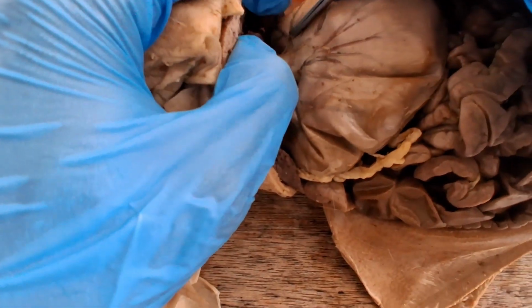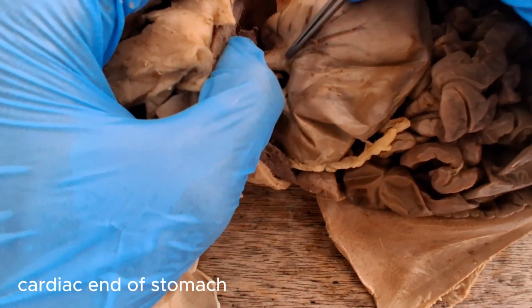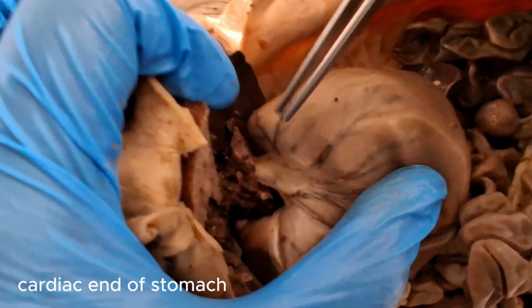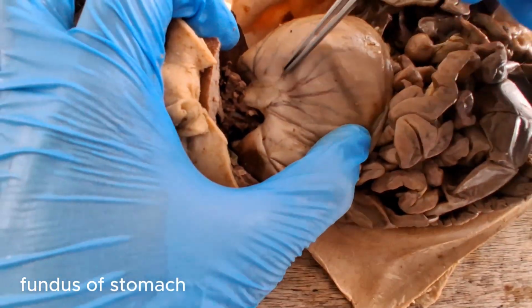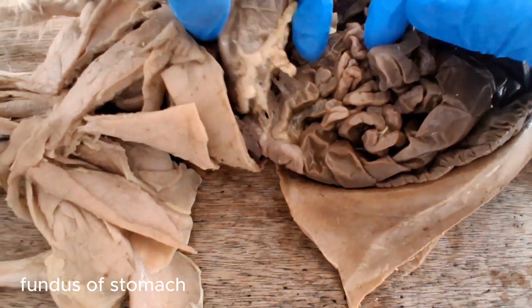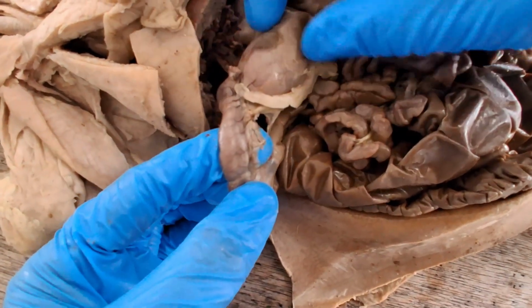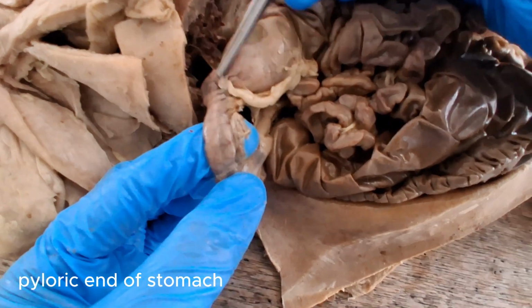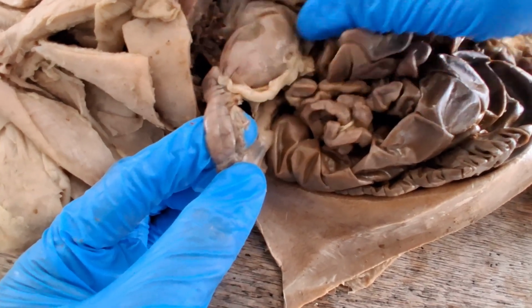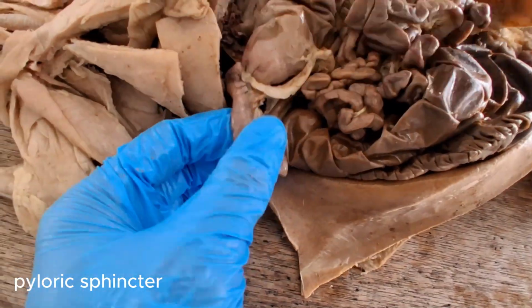The portion nearest the esophagus would be the cardia, and this portion here is the fundus. This is the body of the stomach, and then it tapers off before it enters the small intestine as the pylorus. There's a smooth muscle sphincter that regulates the passage of chyme to the small intestine. Okay, that's the pyloric sphincter.